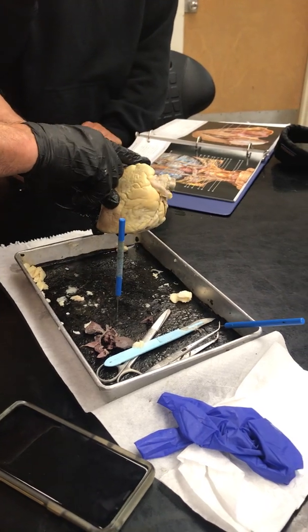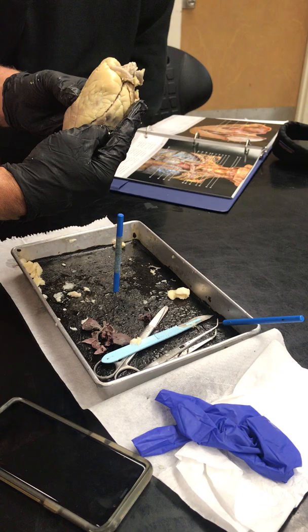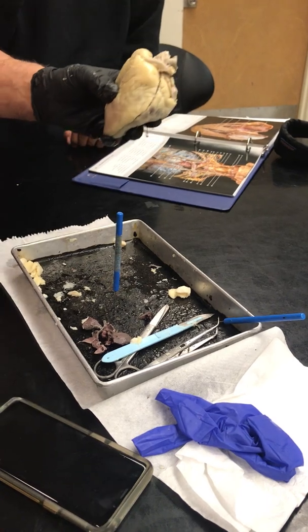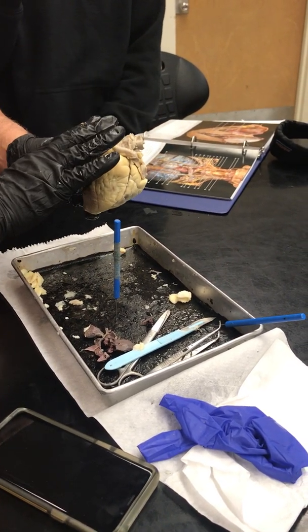So from the right atria, cycles the lungs, to the left atria is pulmonary circulation. Once it goes from the left atria systemically to the right atria is systemic blood.